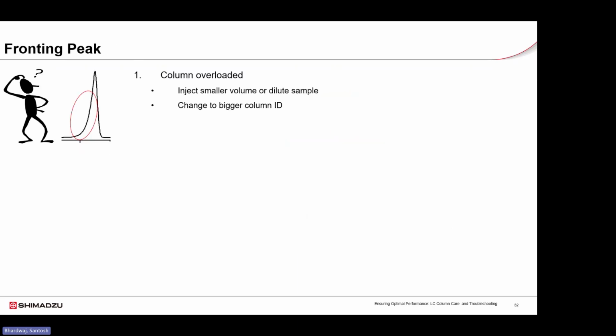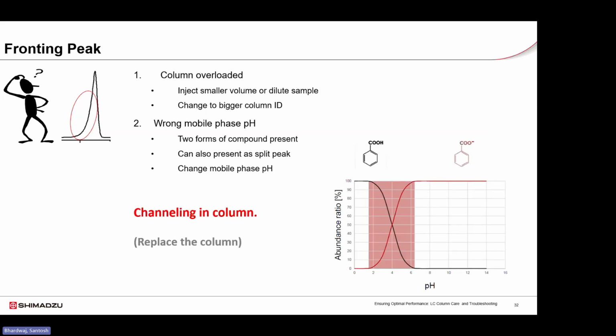Fronting peaks are usually observed when the column is overloaded. So column overloading is an issue for all types of peak shapes. Too much sample at the column inlet saturates the stationary phase. This can be fixed by injecting less sample, diluting it, or using a higher capacity or higher surface area column. Fronting can also be caused by incorrect mobile phase pH. Adjusting the pH and making sure the sample is in a single form helps prevent this. Fronting shows non-linear adsorption, and solving the root cause will restore the peak shape.